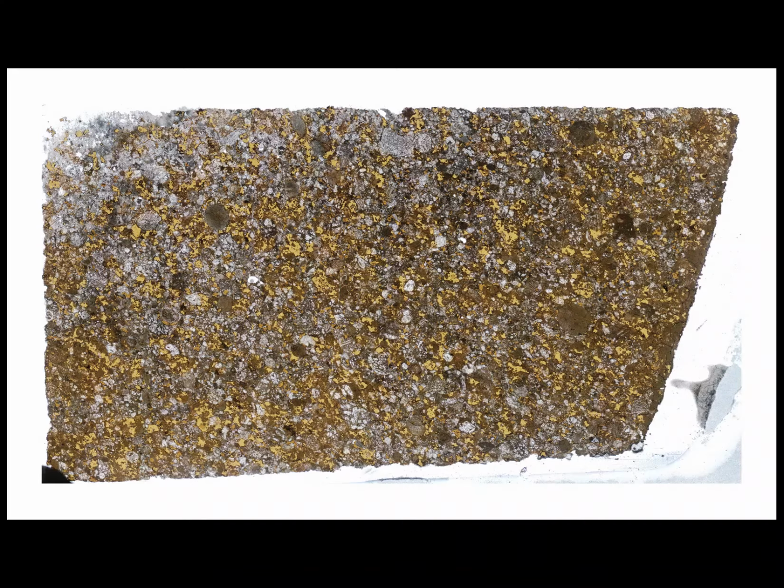So, of course, the first thing you should ever do whenever you get a thin section just like this, stick it under a petrographic microscope. So here you can see what the meteorite looks like at 2x magnification. I took a map of the whole slide and stitched together the individual images to produce what you are seeing here. Compared to just looking at the thin section by eye, a few more things start to jump out. The colors are more dramatic, you can start to see some of the grain shapes and some different textures in there, but we're still missing some of the finer details.